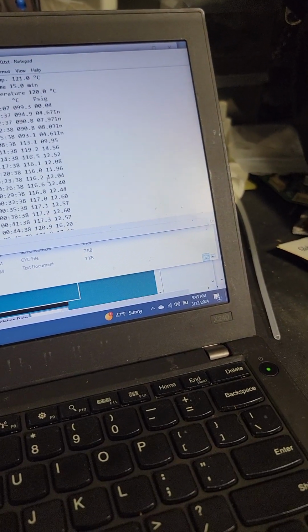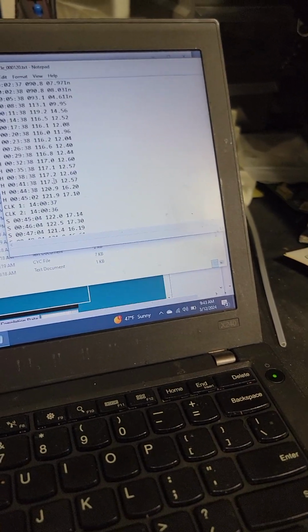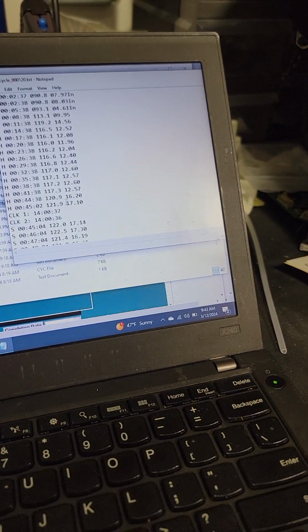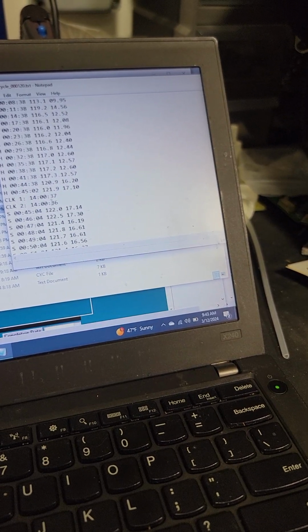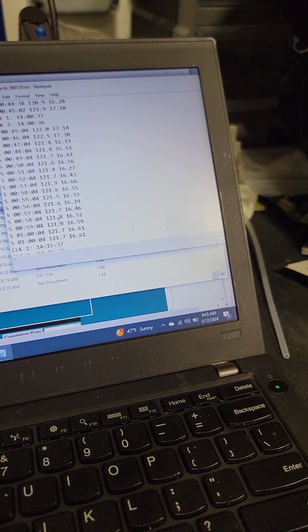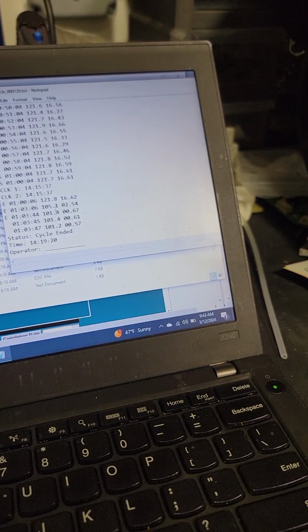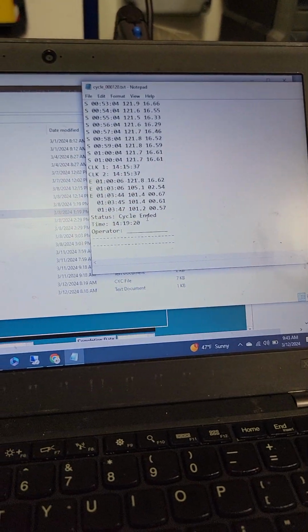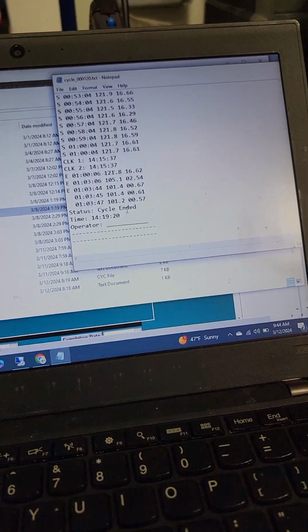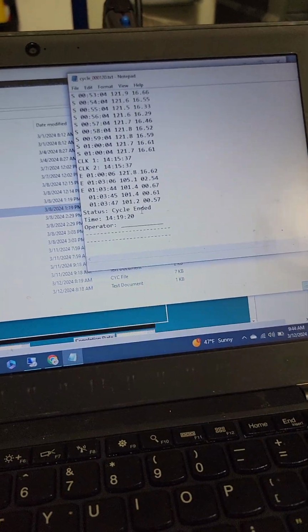And then here's a passing cycle. So boom, boom, boom, 116, 117. All I did is move the needle valve a bit. Look, we got to 121, 17.10, da-da-da. Sterilization started, held, continued, clock data, and then exhausted. That was it. Alright, so that is how you get cycle data from the unit, and this is what it looks like in a text file.